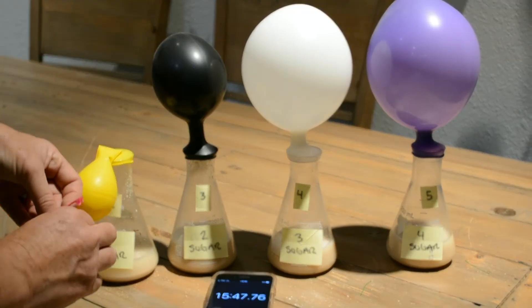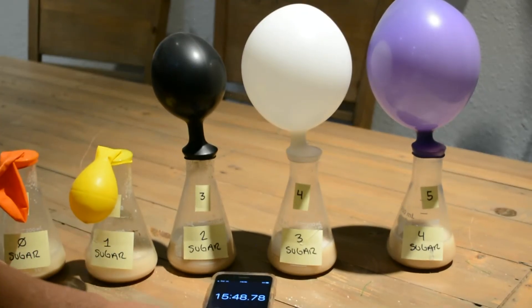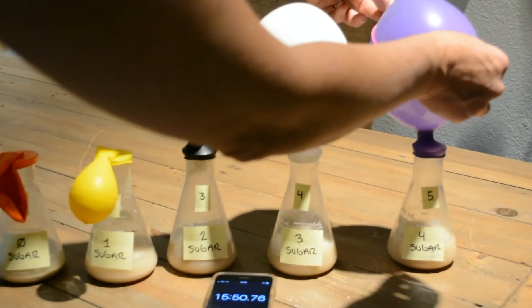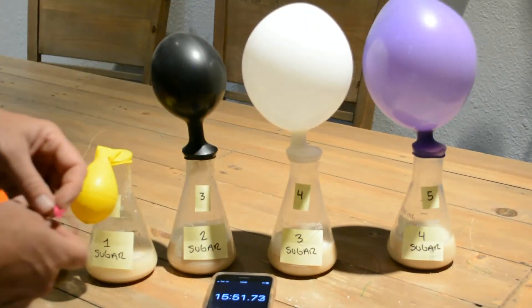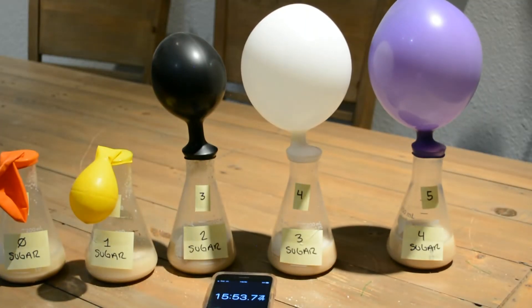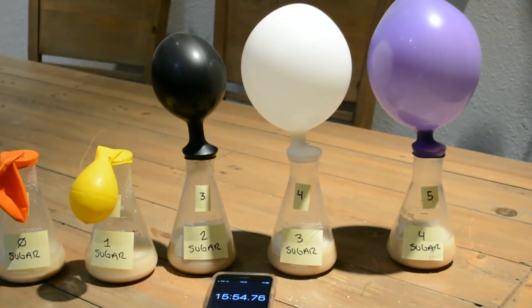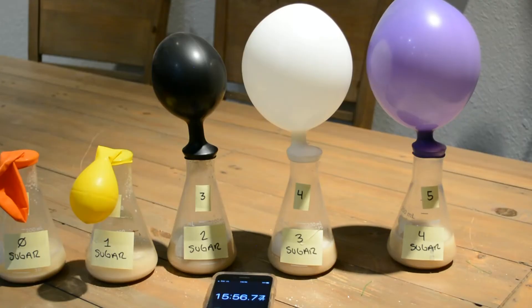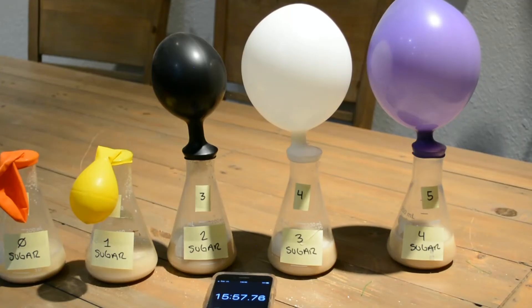One more time — measure out all of your centimeters for every single beaker. Please make sure to stop the video and record the data for the 15-minute mark.